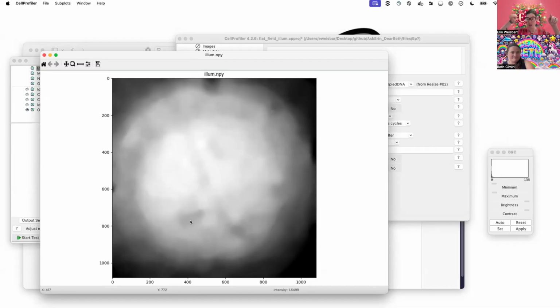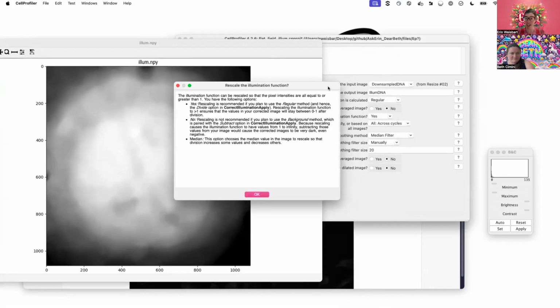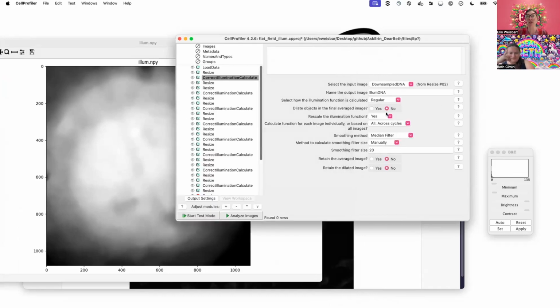If you picture a histogram across the image, we are flattening them, flat field, so that the intensities are even across. That is why we want those values. That would be different if you are not doing division as the math for the application, so keep that in mind for the other kind. So here we do want to set this to rescaling.